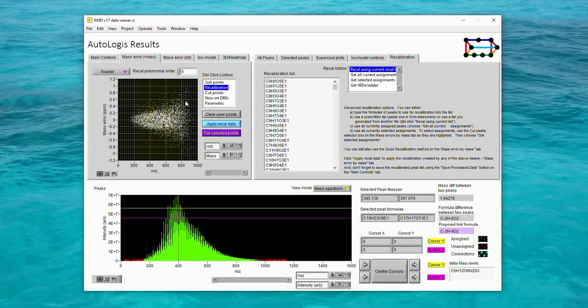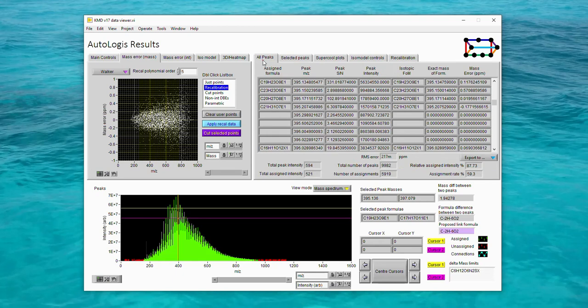So to select Walker mode, again you go back to the recalibration dropdown and choose the Walker option there. And then re-import all the current assignments. And then you can apply this recalibration the same as we have for the other modes. Because of the potential for Walker mode to overfit your data, it's not a recalibration mode that I would use commonly, unless I was specifically working with data which really required it.